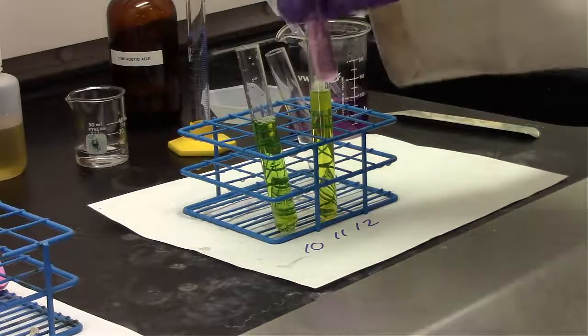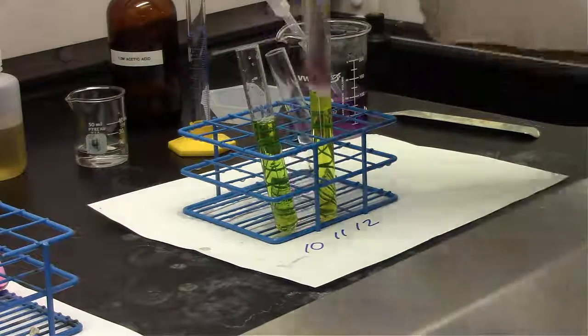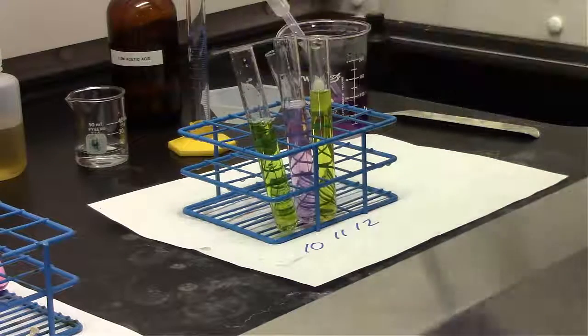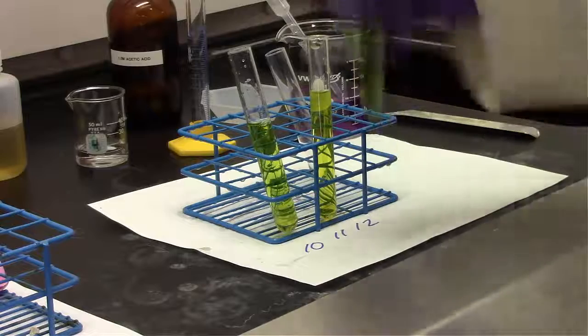For the next, when we had a high concentration of acetic acid, this is acting as a buffer solution. It looks like it's pretty much tied so far with the other one. Okay, now it's slowly starting to turn. Nope, still not basic yet. So this is actually doing better than test tube 10. And remember, we only had acetic acid in that solution, so it wasn't an equal mix of both.